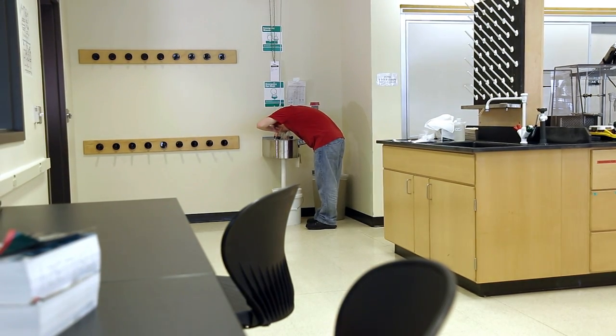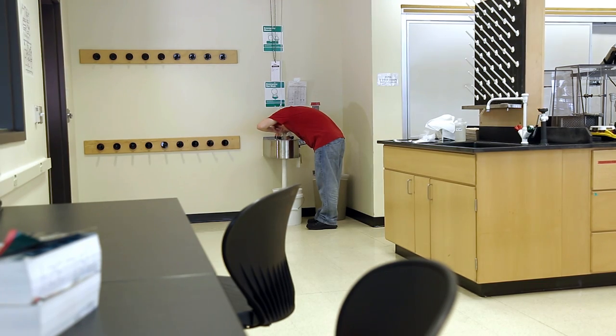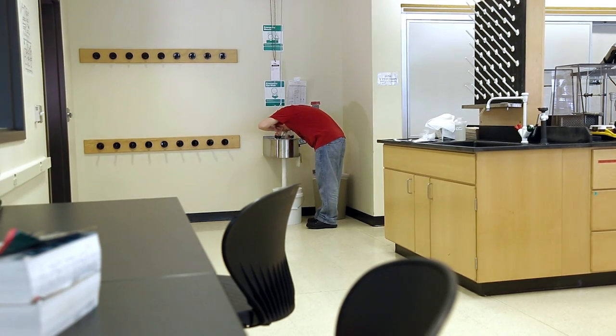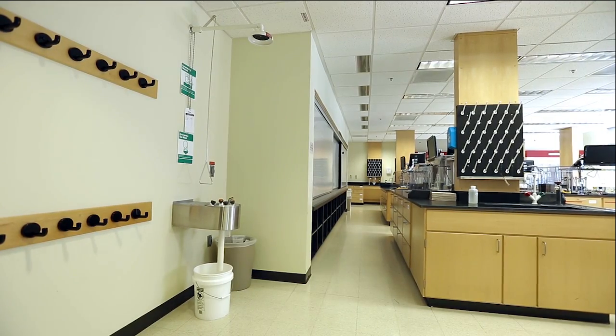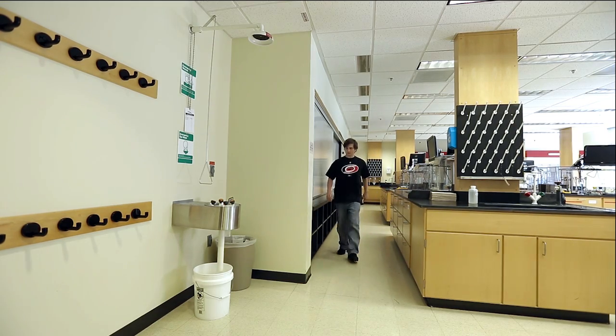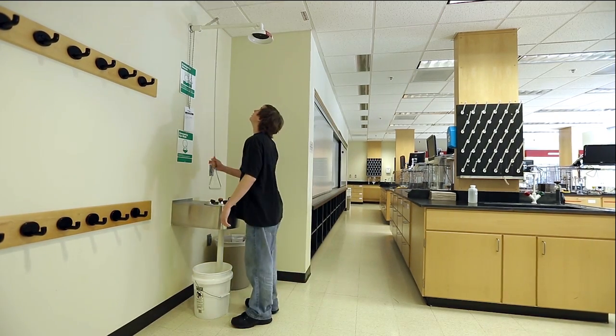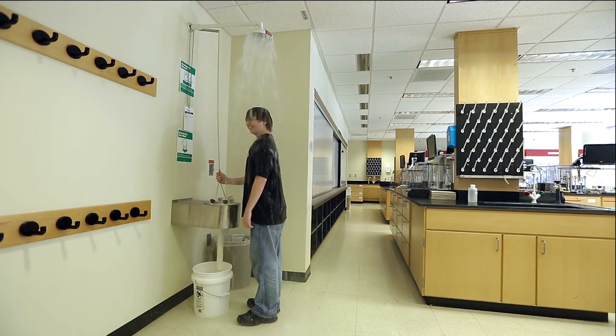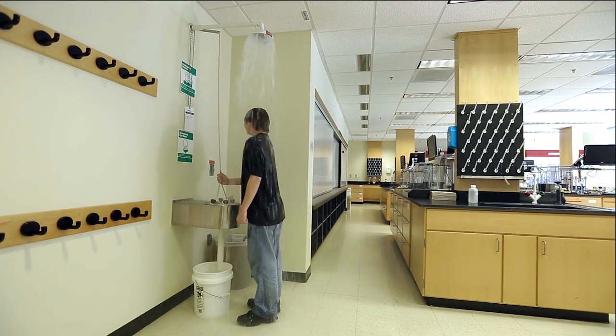Continue the eyewashing process for at least 15 minutes to adequately remove any chemicals. If your skin or clothes have been exposed to a hazardous chemical, immediately move to the shower and pull the lever. Stay in the shower for at least 15 minutes.